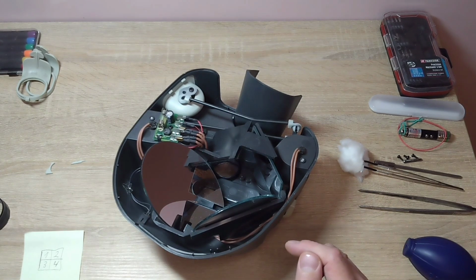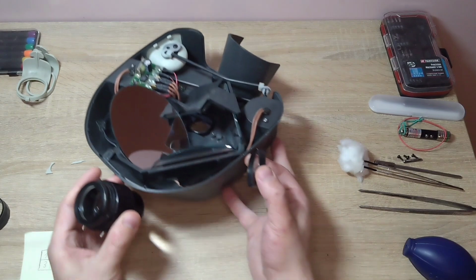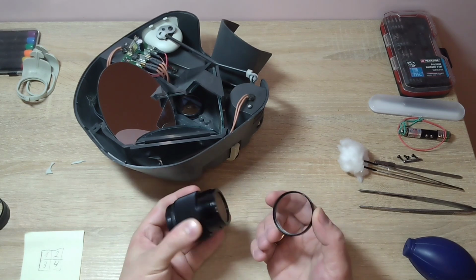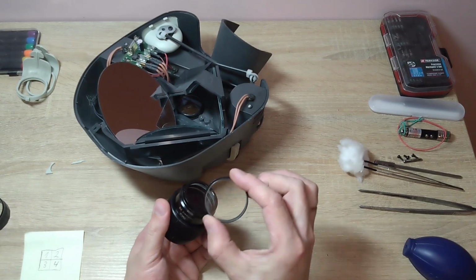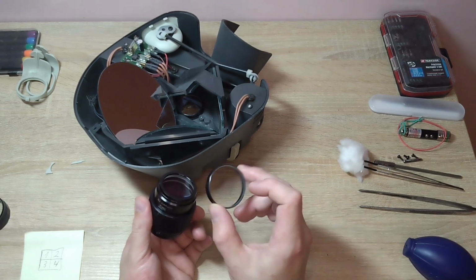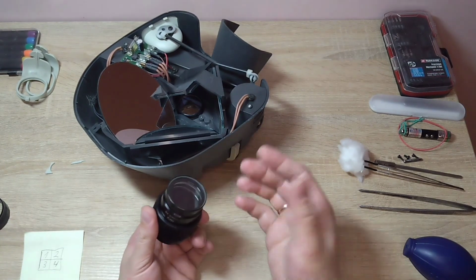What I want to generally say in the observation mode. First, the image passes through this lens, for example, an 8x magnification. Here is such a cap. It is somewhat damaged, but to understand, this protective cap of the main lens can essentially be replaced if it is severely damaged. You can cut a simple glass of this diameter, order it from a glass cutter, place it in the holder, and replace it.